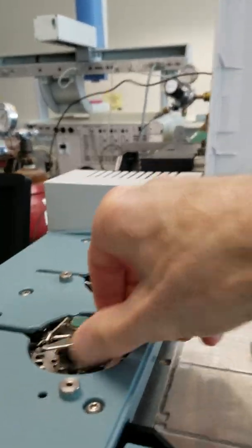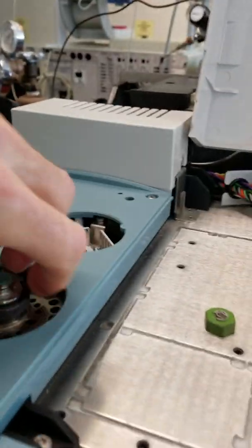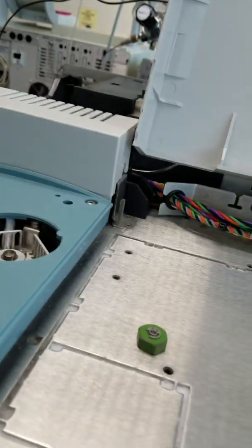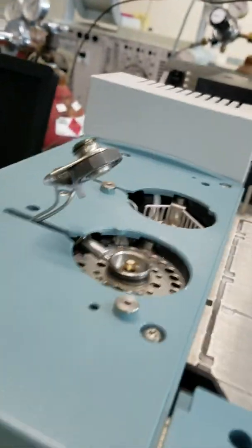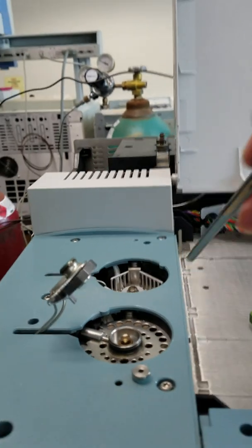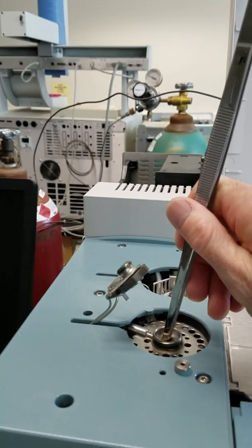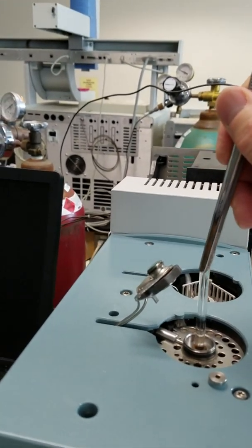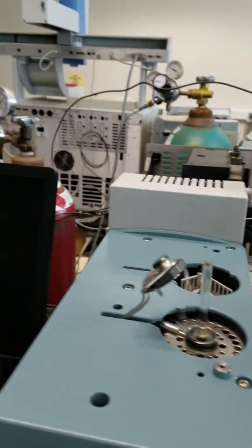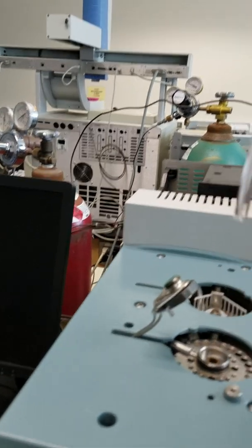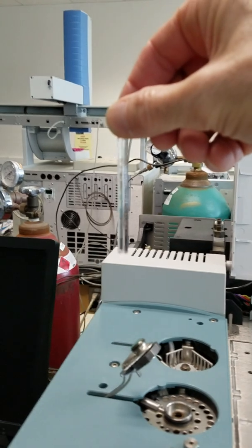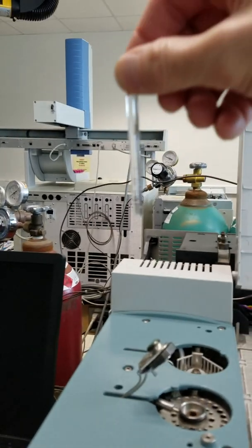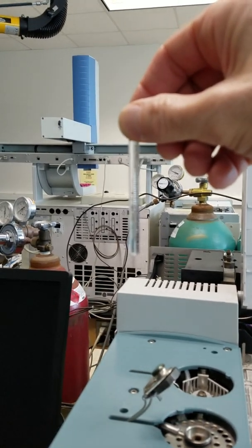If you go a little bit farther into the injector, there's actually a glass liner. I'm going to try to unscrew this. There's the top of the septa piece. Sorry for the camera going all over the place, but there's a glass liner. You can see this glass liner come up right here.